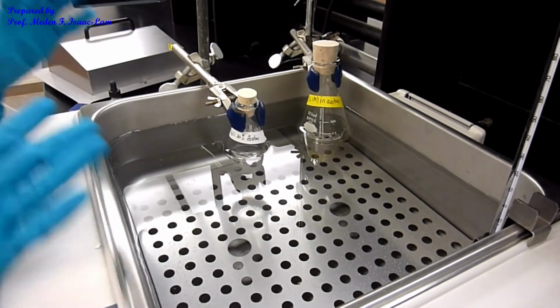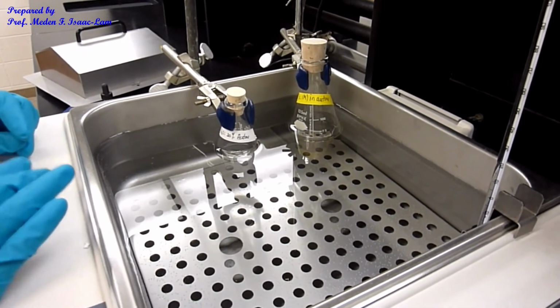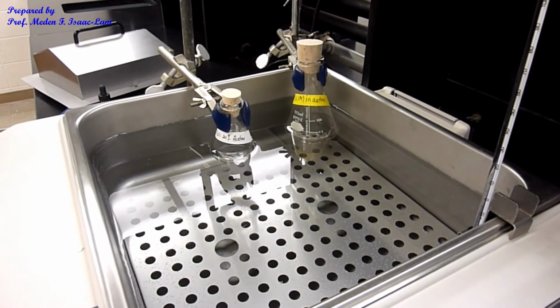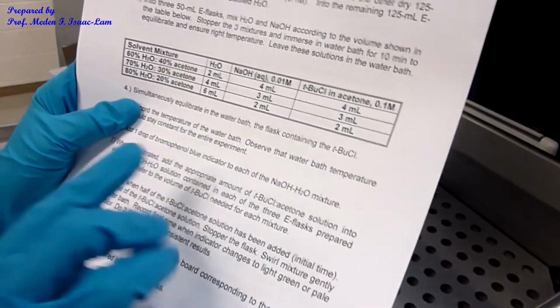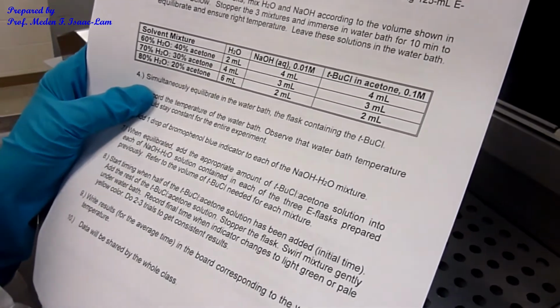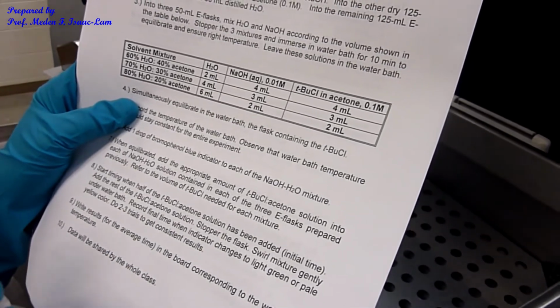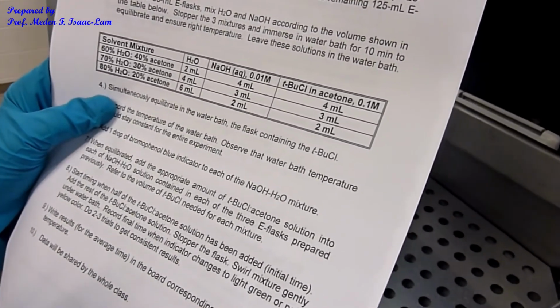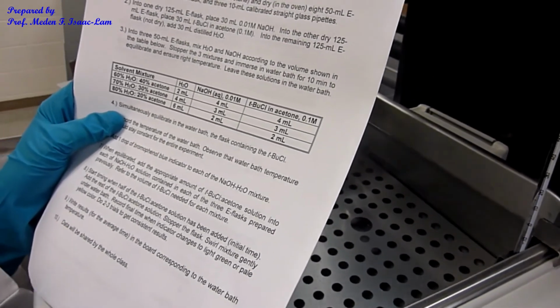And you can also divide the task because you're going to be doing 2 samples for each run. So you're going to be repeating what I did maybe 1 more time or 2 more times depending on the data, because the 2 data should be close to each other. If it's too far, then you have to repeat it.